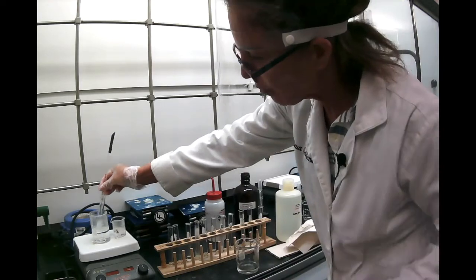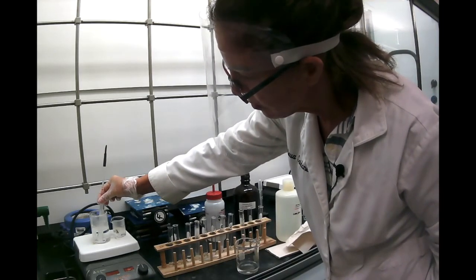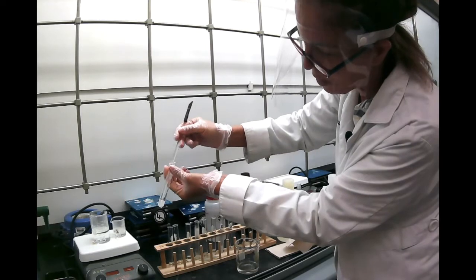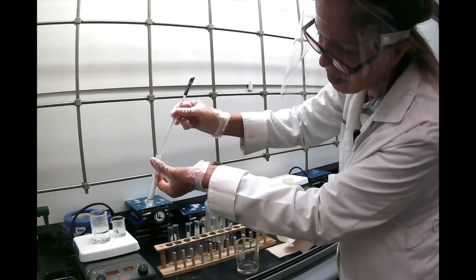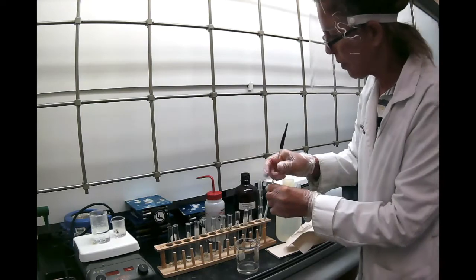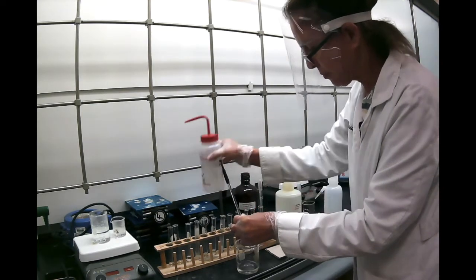So we're going to heat it for a few seconds. And you see it shoots out very quickly. That's the reason you have to be careful when you work with petroleum ether. It's a very low boiling point. And again, it's not dissolving. So benzoic acid is not soluble in petroleum ether, both cold and hot.